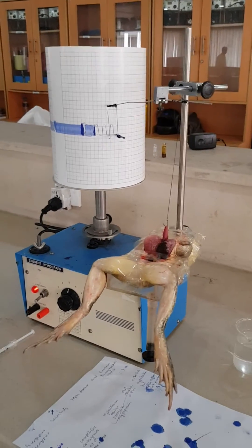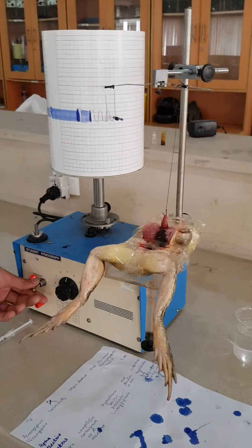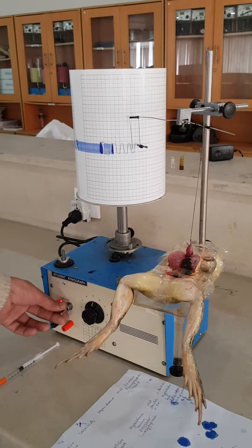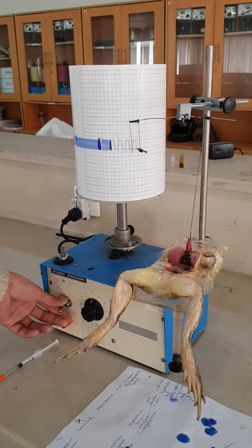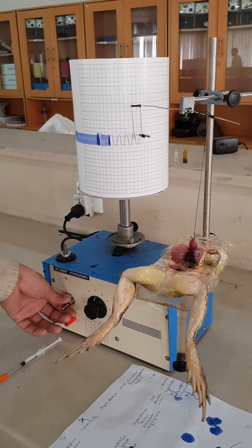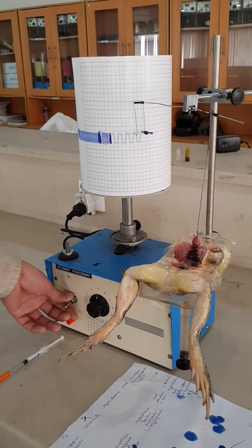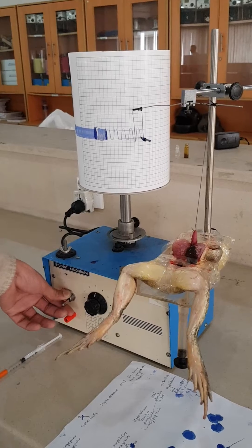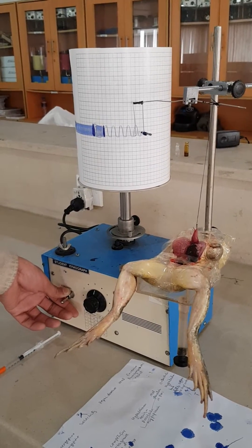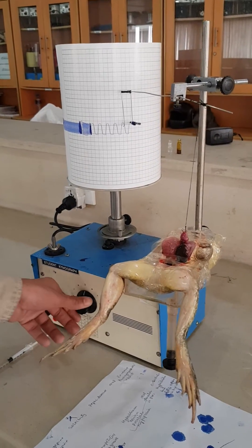After this we are working. Once the drug is applied, we check the effects. After that we will record the stroke and then stop it.